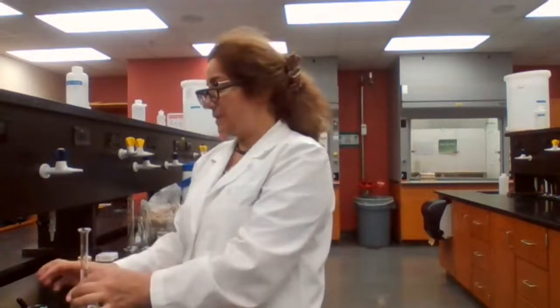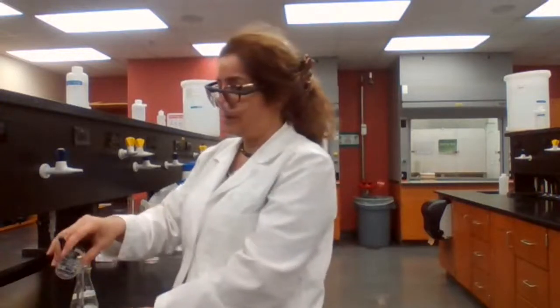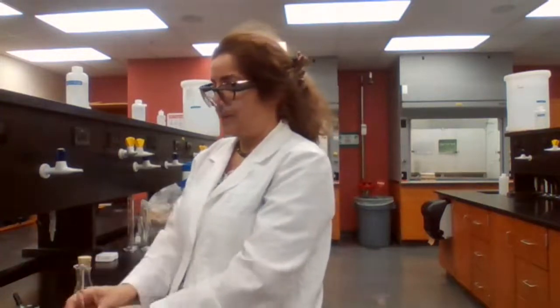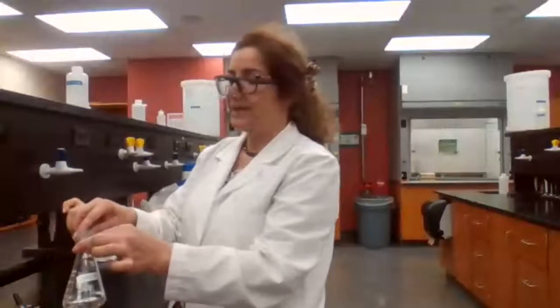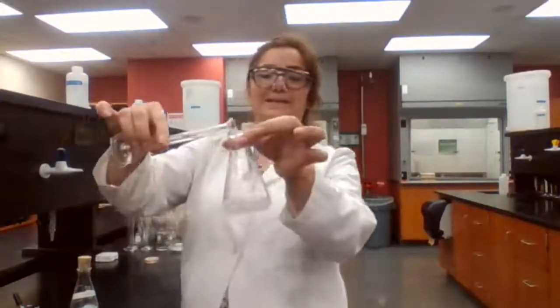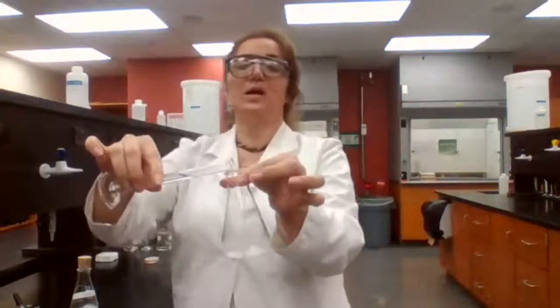10 milliliters? Okay. Can I add 10 milliliters of the 3 molar HCl? The quantity of the HCl, see what's happening? You can take the next screenshot.